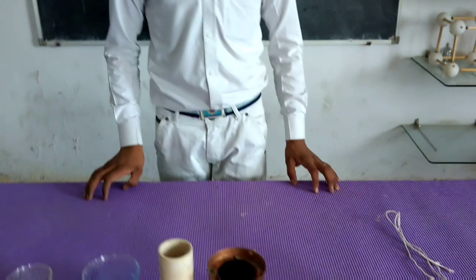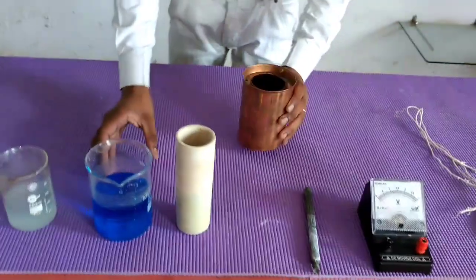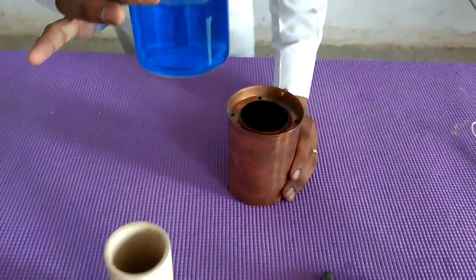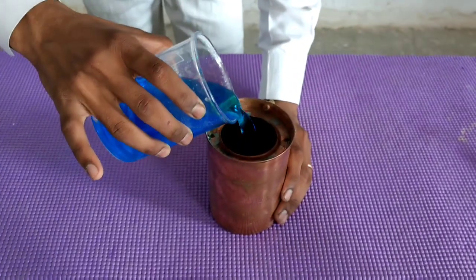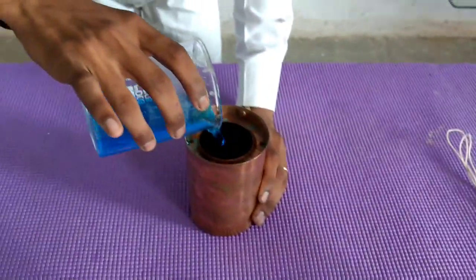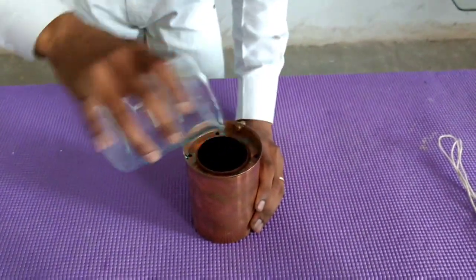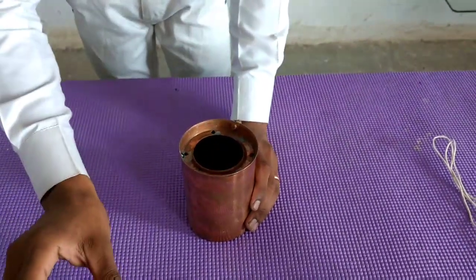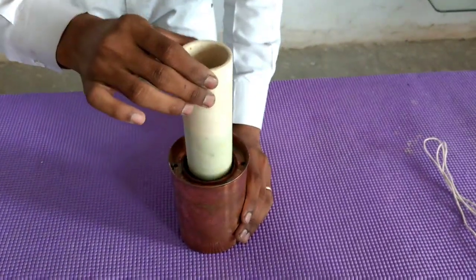In this video, Mahesh is going to show you the formation of an electrochemical cell — the Daniell cell. He is adding copper sulfate solution having a molarity of 1 molar into a copper container.